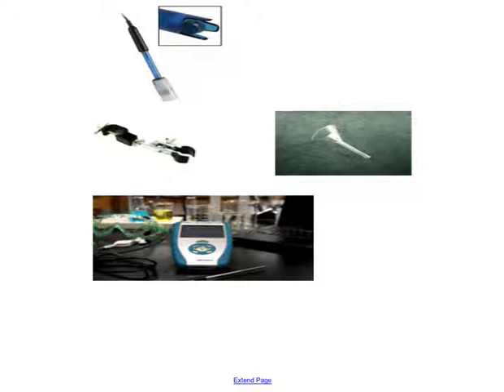Well, this is a pH titration, so we're going to have to use a pH sensor. This is a pH sensor, and we're going to attach it to the LabQuest. You guys used LabQuest in the last lab with the colorimeter. Now we're just changing the sensor we are using.